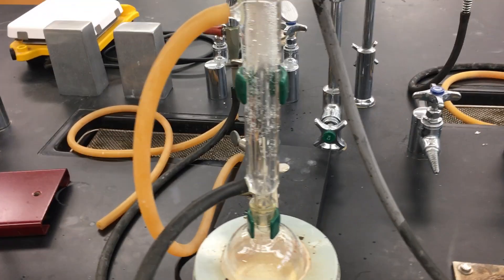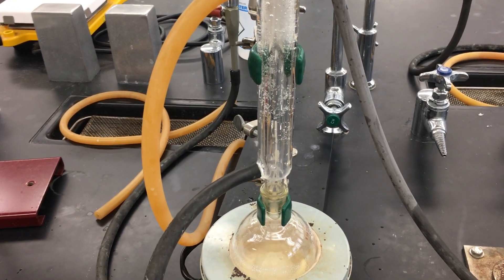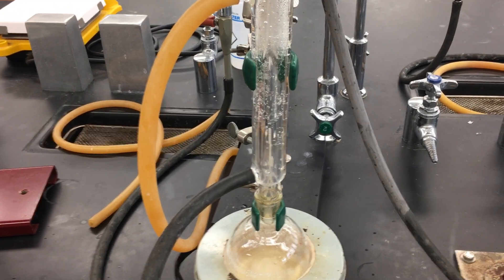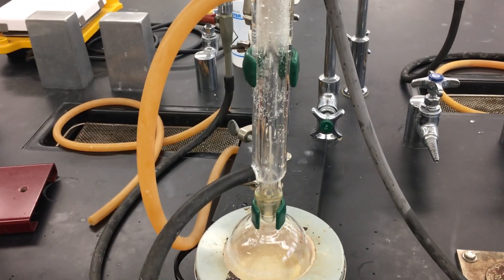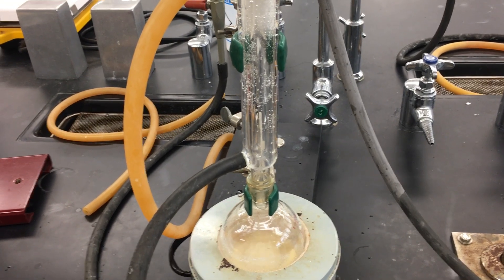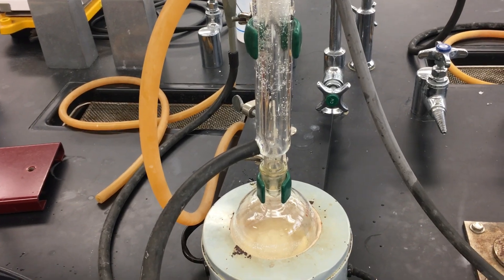We will continue our reflux for about 20 minutes and then we will stop our heating and allow our reaction flask to cool down. Once it's cool, we will use the same reaction flask for our first distillation.